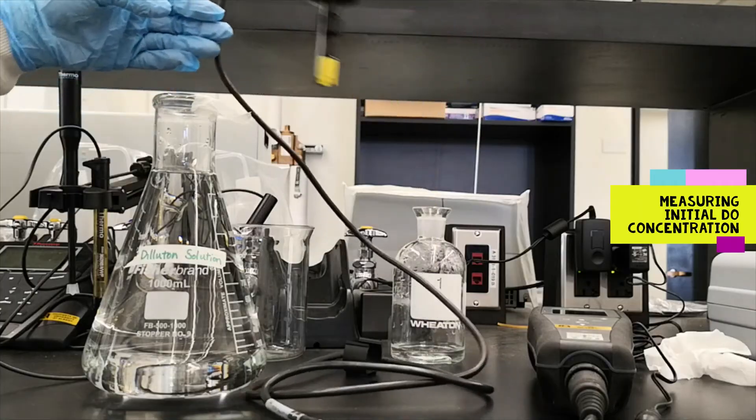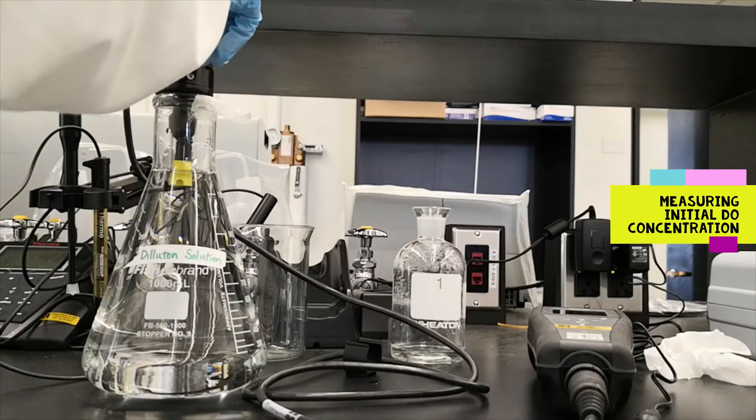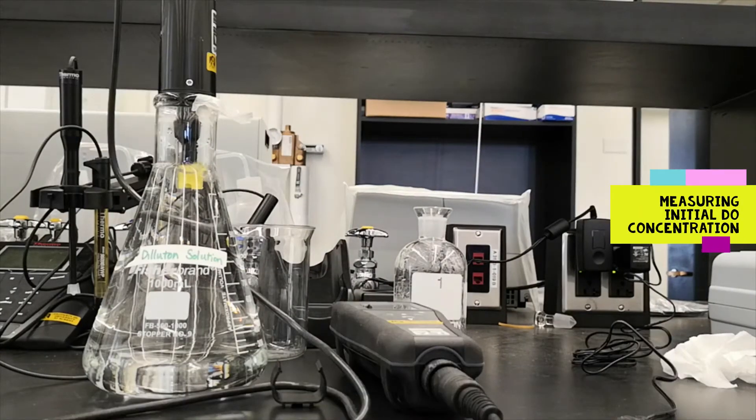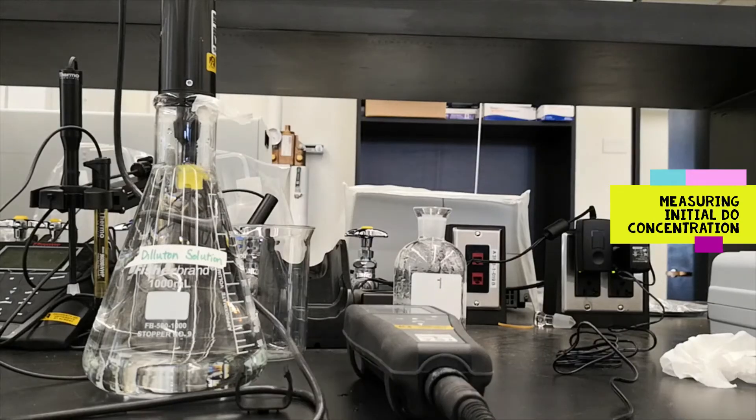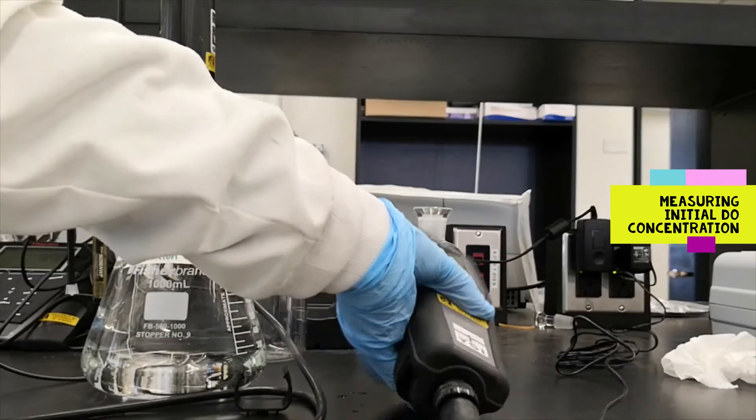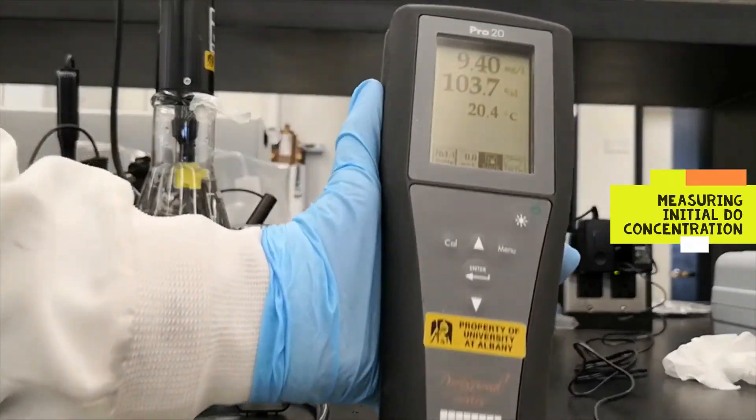Then, let's start. We are going to measure the initial DO concentration first. And here is the initial DO concentration we are going to use.